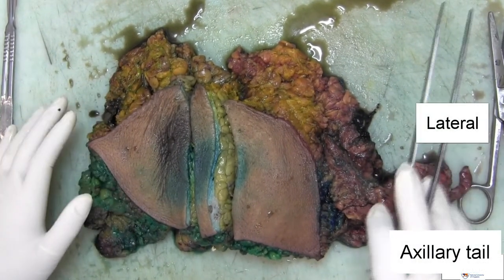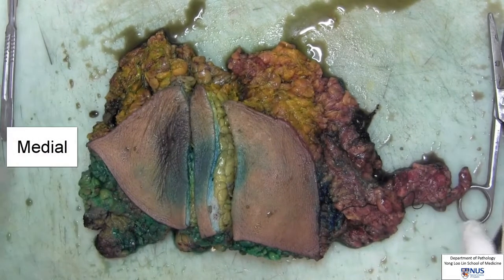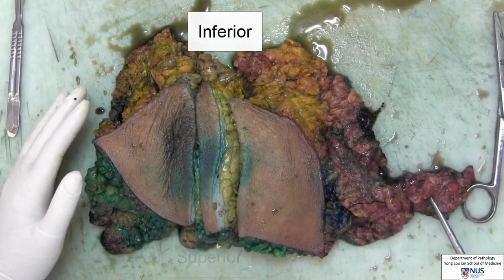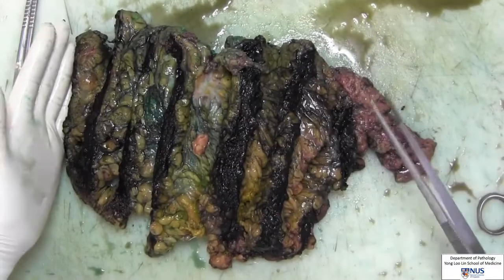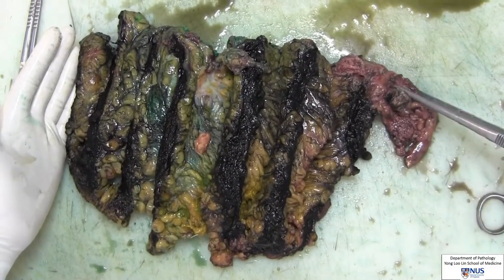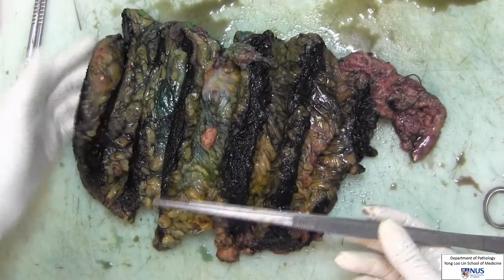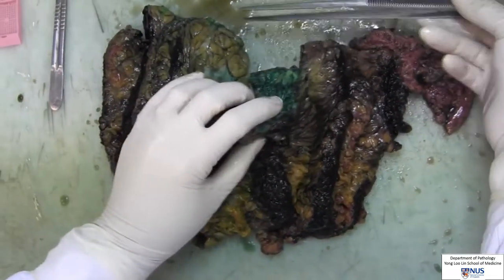This is the lateral margin, the medial margin, and the superior and inferior margin. We will now flip over the specimen. The posterior margin is inked black, and the superior is inked green.